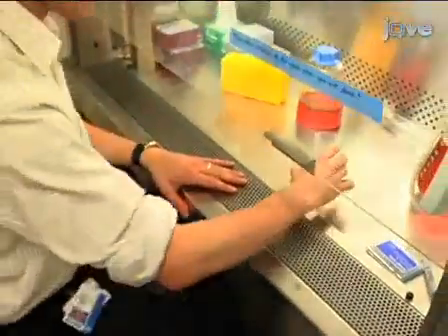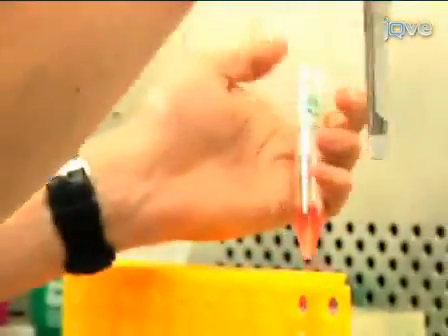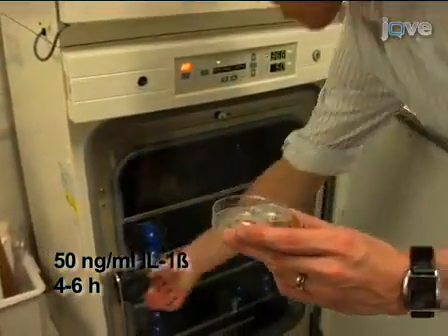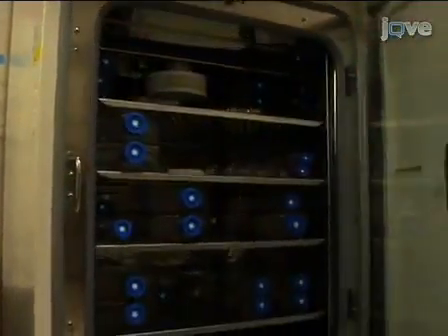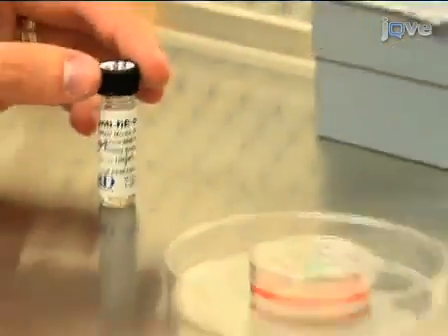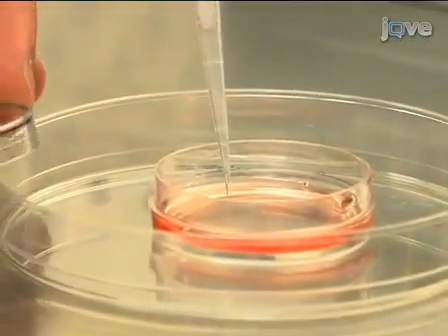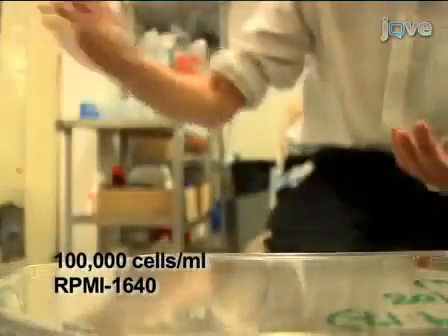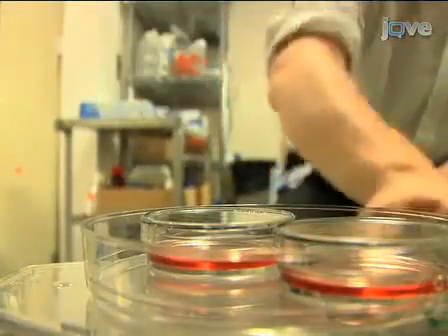To upregulate E-Selectin expression, aspirate the growth medium and add fresh medium with 50 nanograms per ml of IL-1 beta. Incubate for 4 to 6 hours. Cell monolayers are now ready for the flow chamber assay. Additional plates of HbMEC60 cells can be stimulated with IL-1 beta and treated with neutralizing anti-human E-Selectin antibody at 20 micrograms per ml for 1 hour at 37 degrees Celsius. This will control for functional expression of E-Selectin.